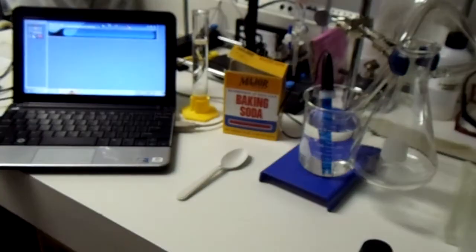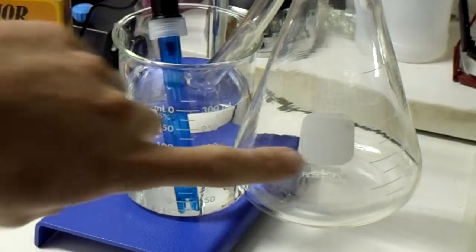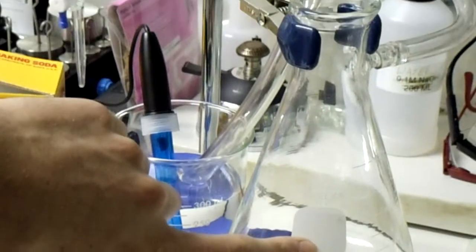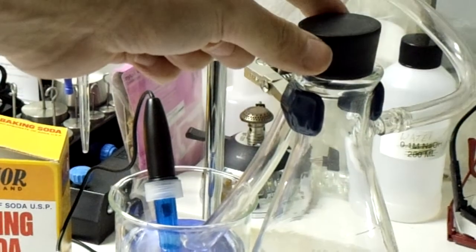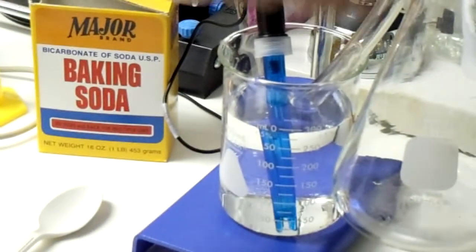So I have a similar setup here. I don't actually have that kit, but what I do have is a flask, and in this flask I will throw in the sodium bicarbonate. I will then pour the vinegar in, and I will actually cap this off, because I do not have that container. So I will throw a cap on here so that the gas that I create is forced to run into this chamber here where I have the hose running into.